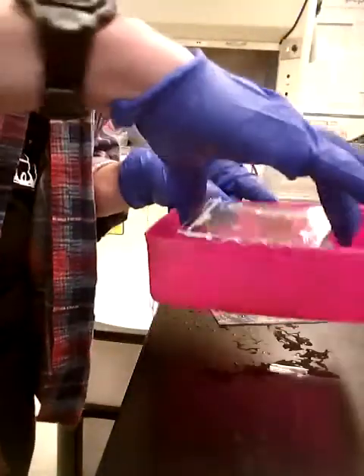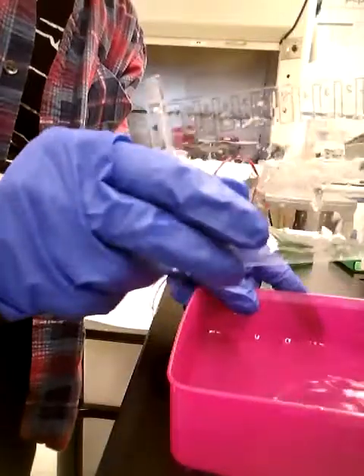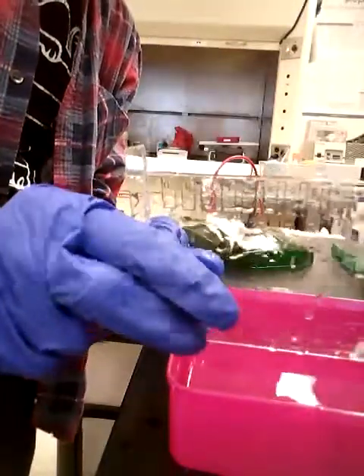Gel's on here — all you have to do to get the gel off is just put it into the water and lift up one end a few times. Gel comes clean off — voila. Shucking the lab oyster.